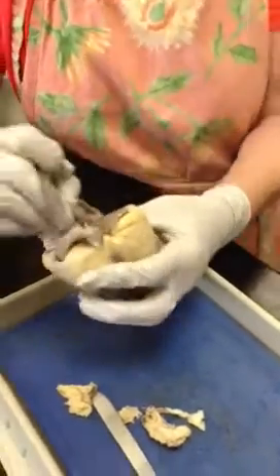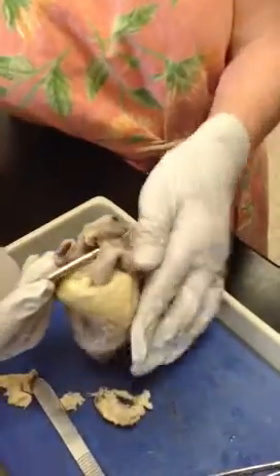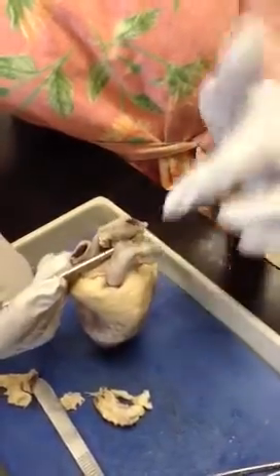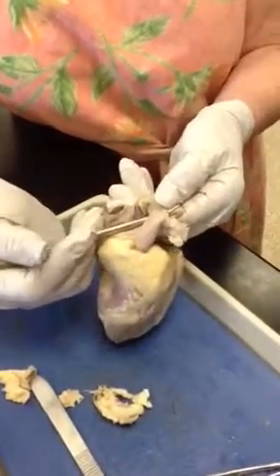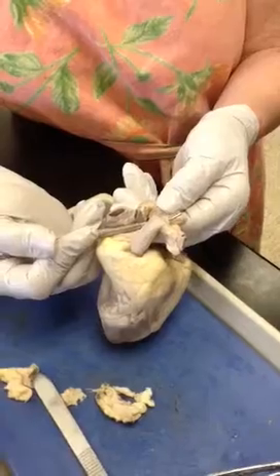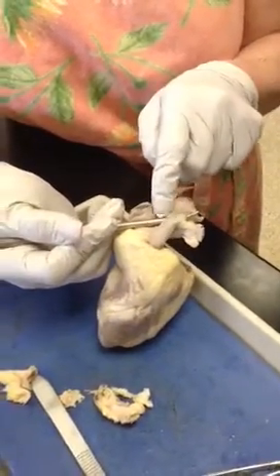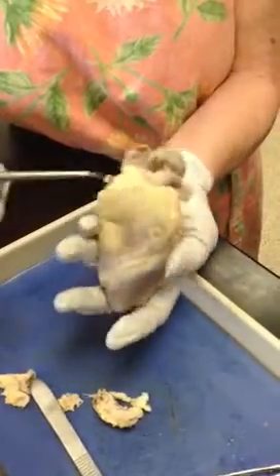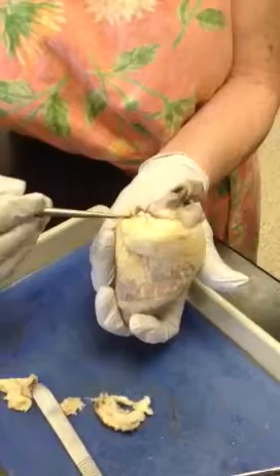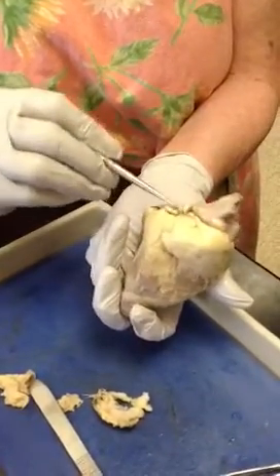Now, on this part, you do have the junction between the pulmonary artery and the aorta. That's the ligamentum arteriosum. This structure right here. Here is my left atrium. My right atrium has gotten chopped a little bit, but this would be the right atrium.